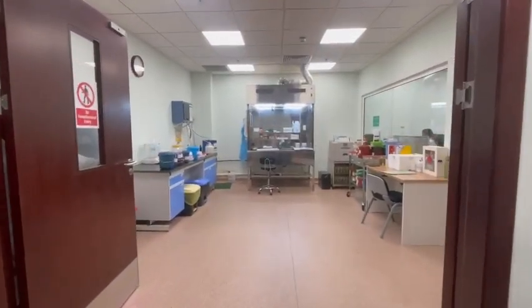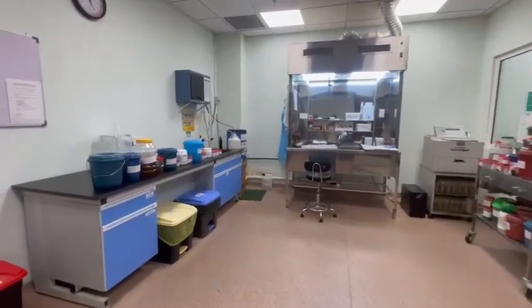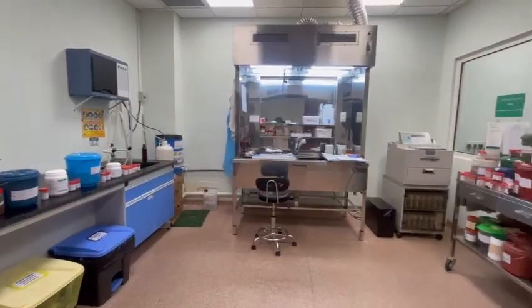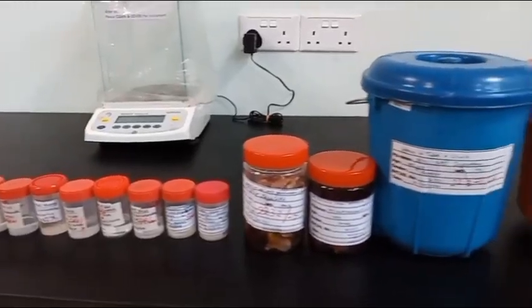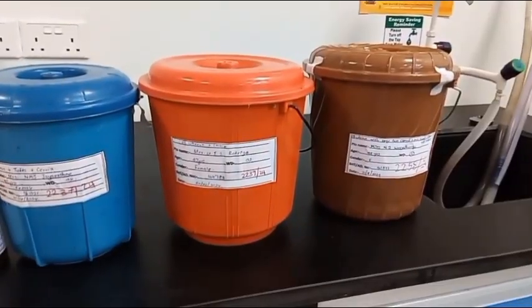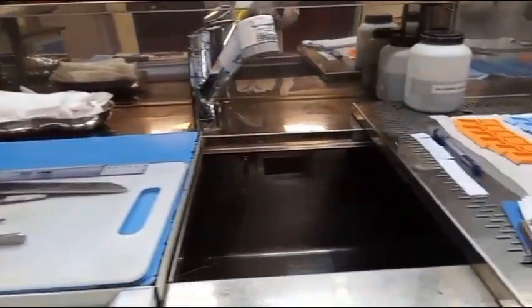The macroscopic cut-up, specimen grossing. The macroscopic cut-up should be ideally done at a cut-up station or a grossing station. If a cut-up station is not available, a well-ventilated and well-lit space with running water and an adequate, flat surface to do the cut-up could be used. The cut-up should be done by the pathologist or a trained medical officer.